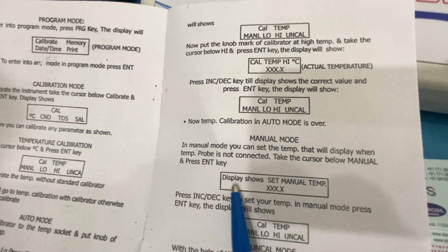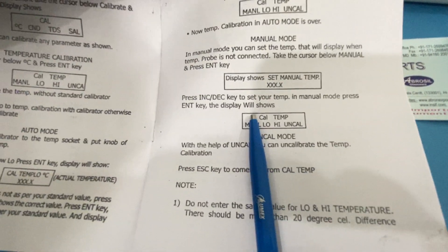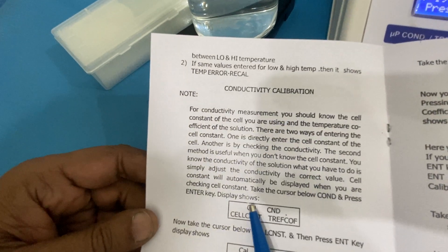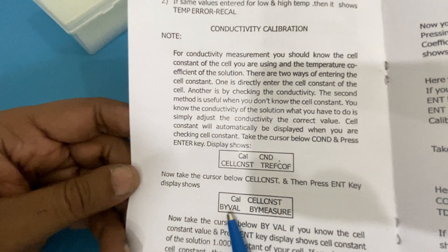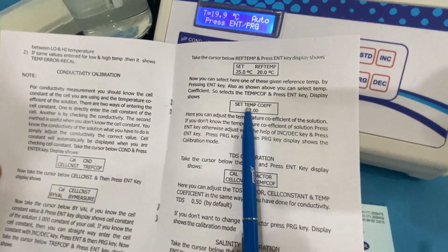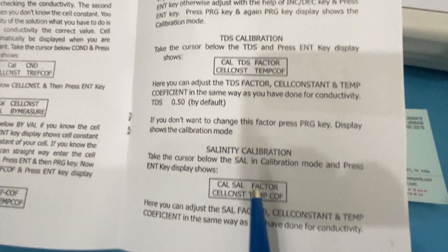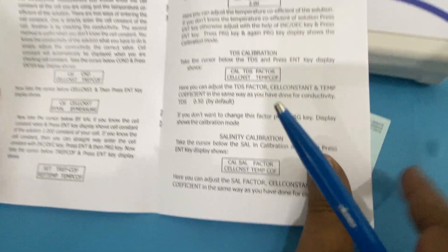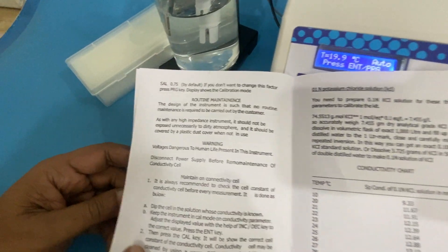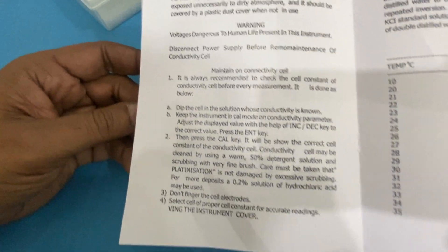It shows how temperature displays in manual mode and how to check it. You can use conductivity by selecting the conductivity option — it tells you the conductivity. If you select temperature, it tells you the temperature. Then there is calibration mode and maintenance, plus the keys for any other requirements.